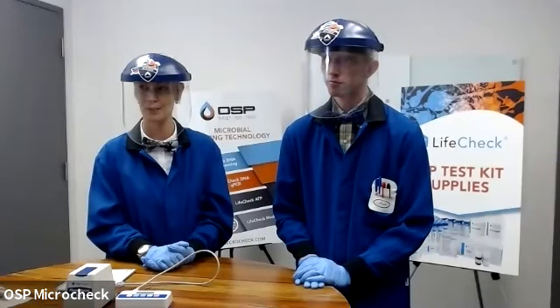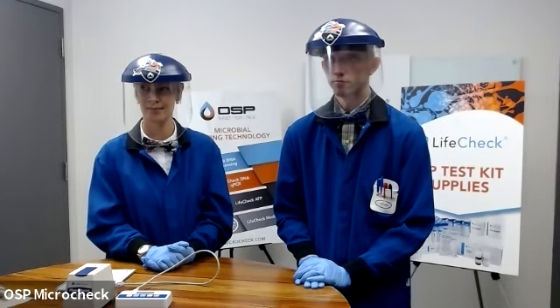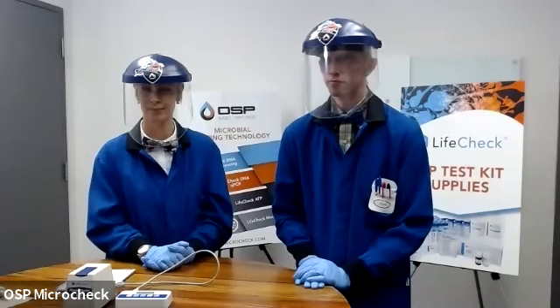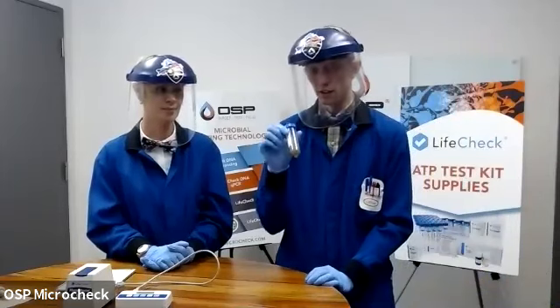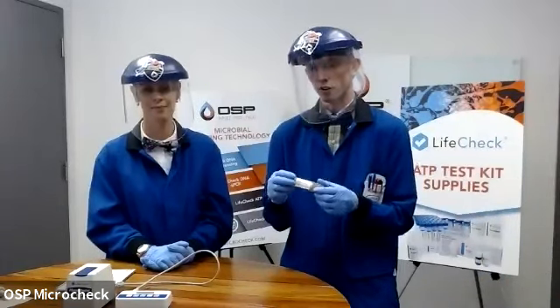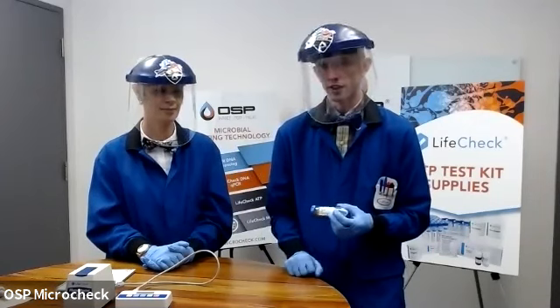Is filtration required for, like you've shown earlier, a sludge style sample? Will the solids in the sludge interfere with the RLUs generated and measured? So filtration is always going to be the best way to go. If you are doing that non-filtration method, adding it directly to this larger tube, yeah, it is possible that things you are adding in there are going to slow down or inhibit some of the action of the lysis agent and of the assay in the end there.